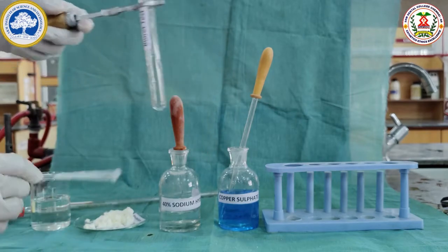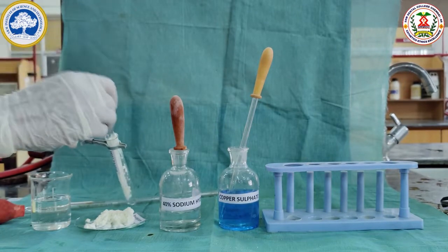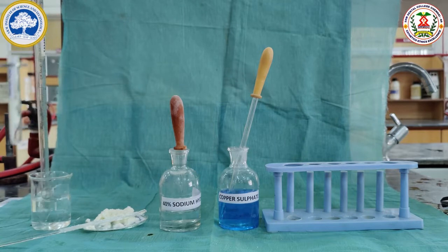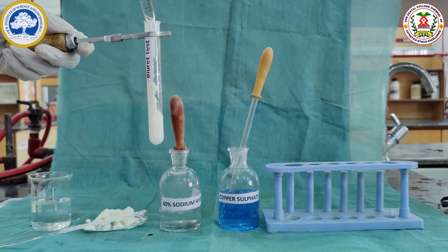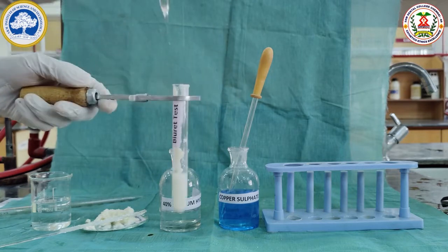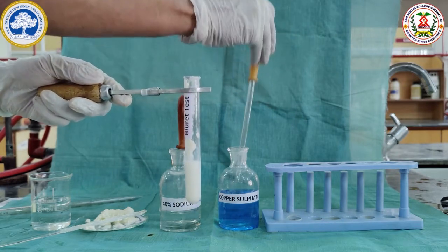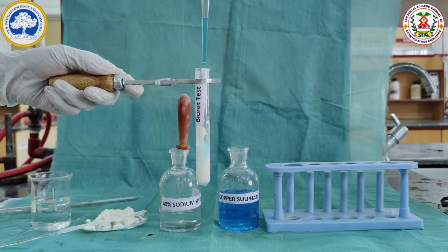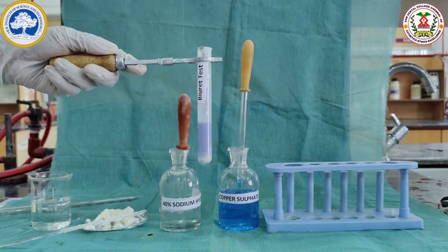The precipitate separated contains the insoluble protein casein. Here we are going to do the test for protein, which is the biuret test. For this, a little of the precipitate is taken and dissolved in 3 ml of water. Then, 5 drops of 40% sodium hydroxide is added to make it alkaline, followed by 3 drops of copper sulphate. The formation of violet colour shows the presence of the protein casein.